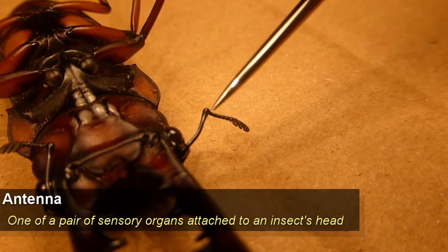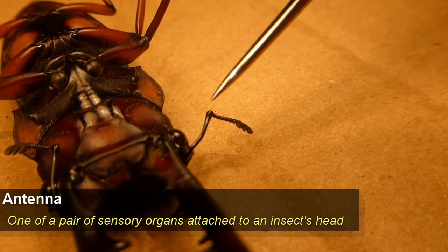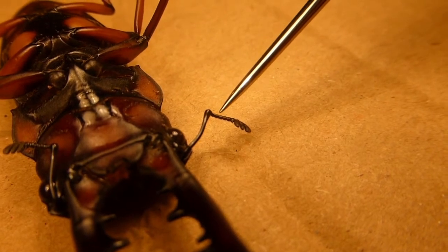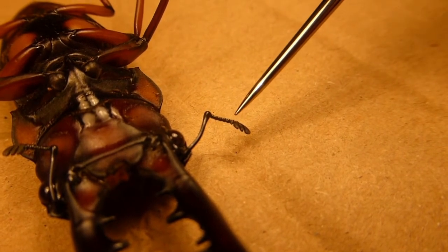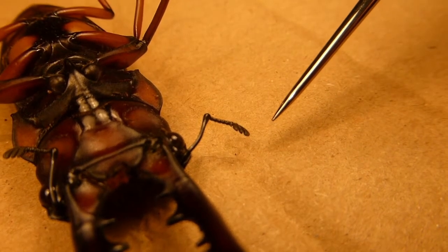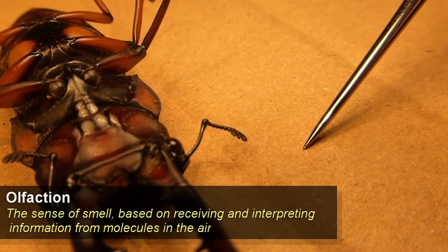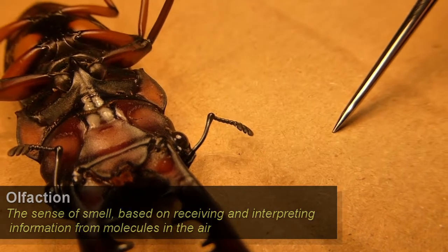I've folded one of the antennae out here — the beetle has a pair of antennae, and this is the right one from the beetle's perspective. You can see it is segmented, with these small ball-like objects that join together, and then a fringed margin at the end. The antennae is a sensory organ. In a lot of insects it will be used for olfactory communication — especially moths and cockroaches do a lot of communication via smell.